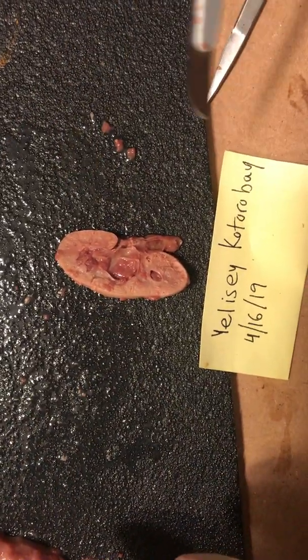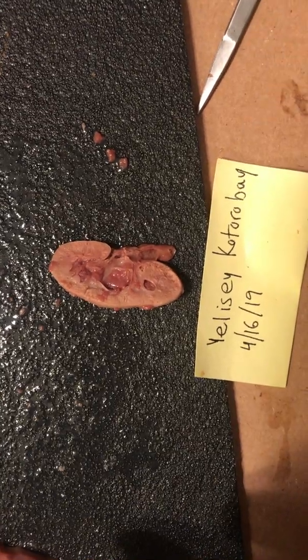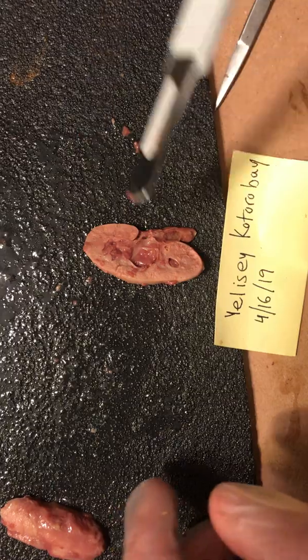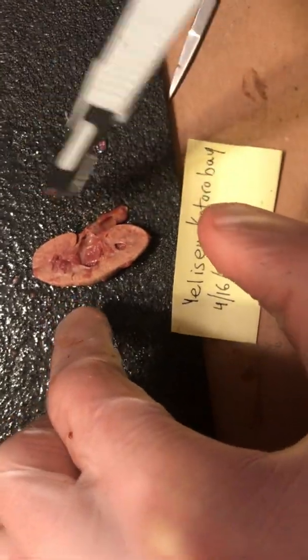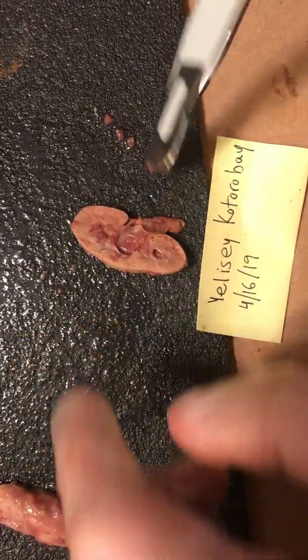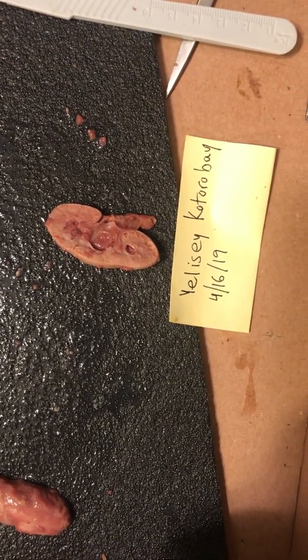So you can still see the minor and major calyx. The small pyramid-like structures are a little bit hard to identify, but they're still there. The renal pelvis is always an easy one, and the cortex, as always, is still there. And this ultimately concludes our dissection. Thank you.